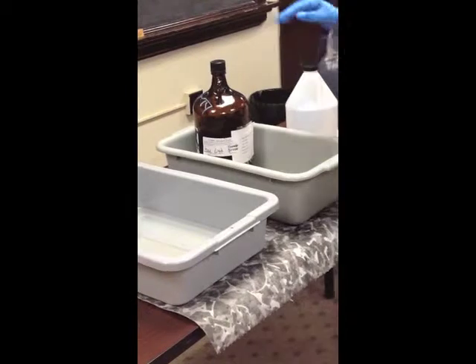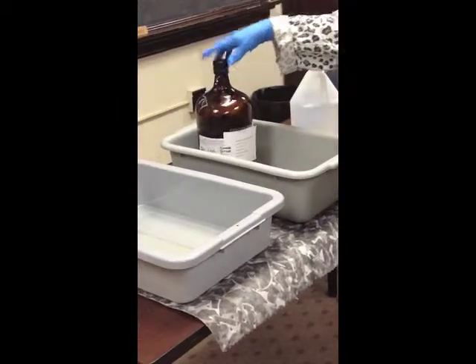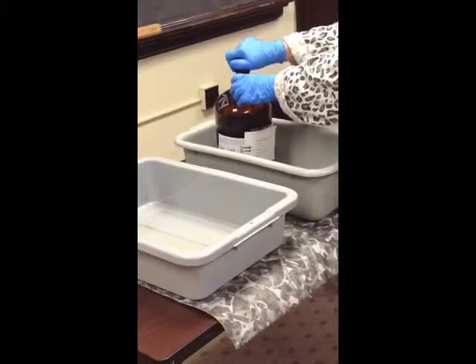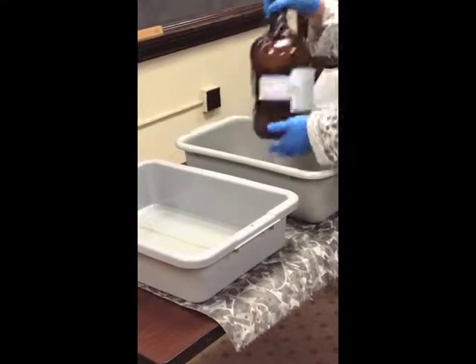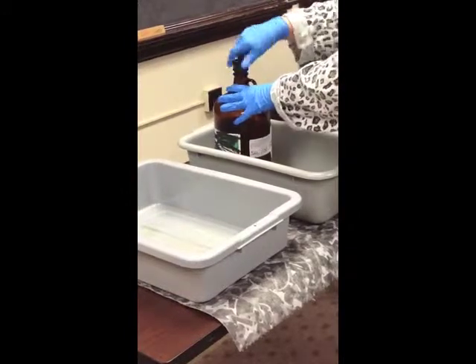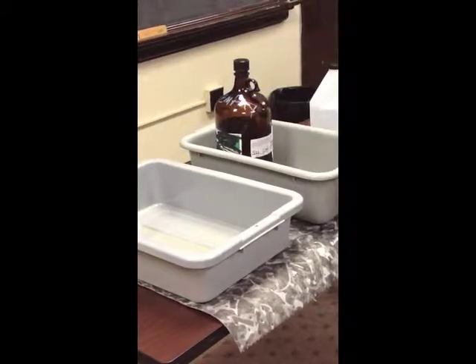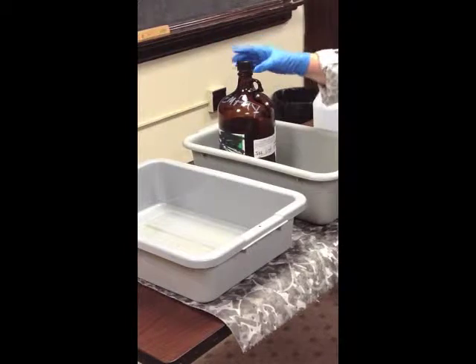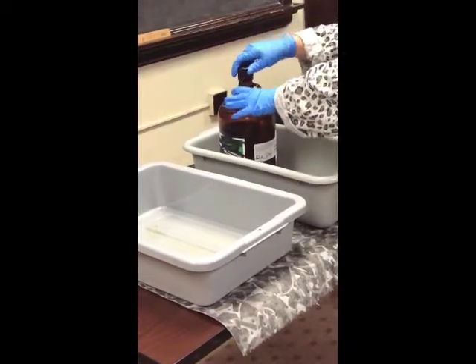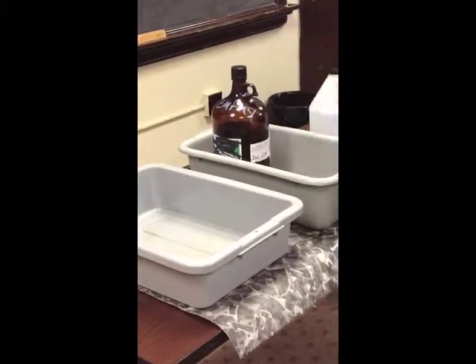The other thing you need to make sure of when you have hazardous waste in your satellite accumulation area is that it needs to be tightly closed, which means if I tighten it down and turn it, nothing leaks out. If you just put it on and do a quick little turn, that's not a tightly closed container. So just be sure you tightly close it each time you add to the container.